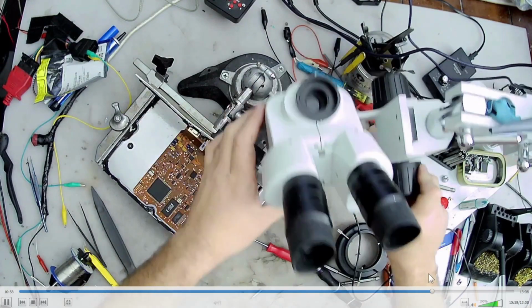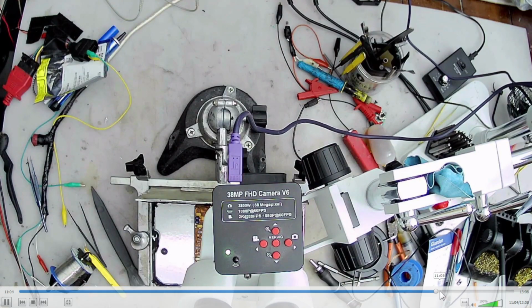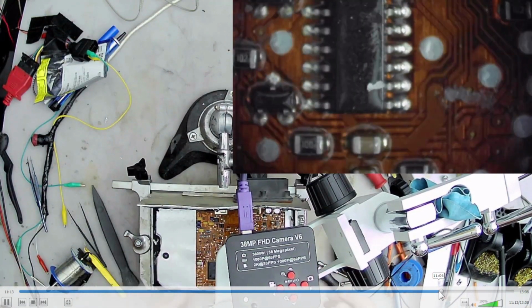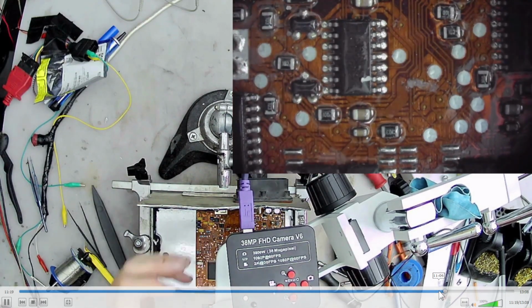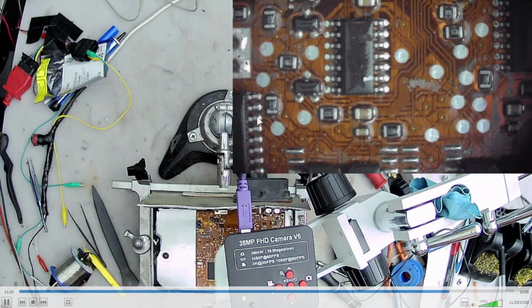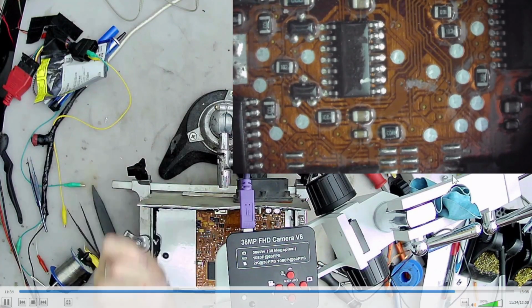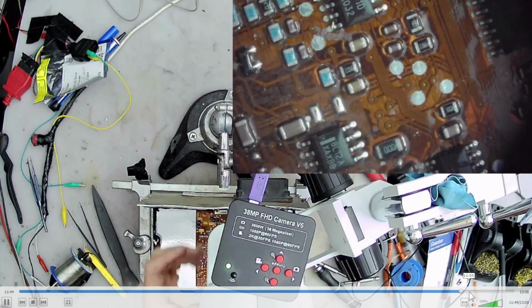But let's go ahead and see here, I was testing everything, and I think that's about it. There's really not much more to it. The reason it's still turning right now is because I don't have the camera holding that screw in. The port itself is firm now, it's not moving, but the external camera part I haven't tightened yet. I just want to concern myself with the alignment of the lens, the internal port. And you can see here, it's still kind of black, so I didn't do an excellent job. I just did a fair job. And you'll see it's kind of black still in this corner, which is acceptable for me.